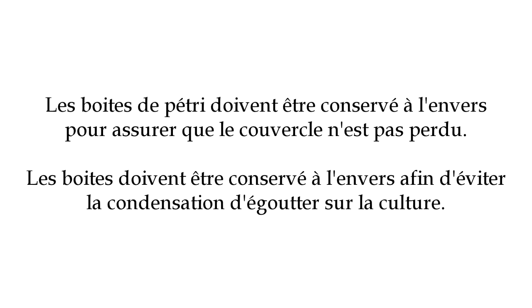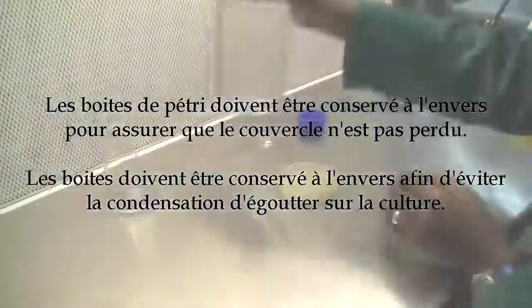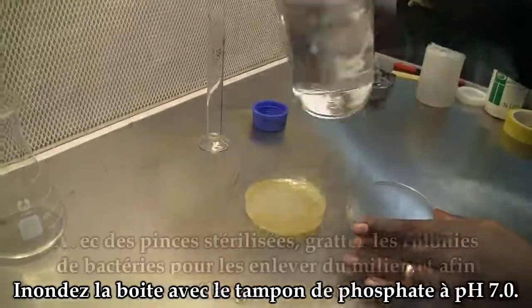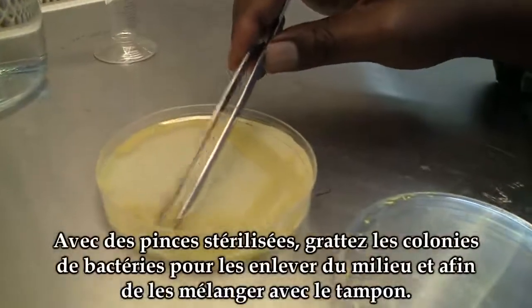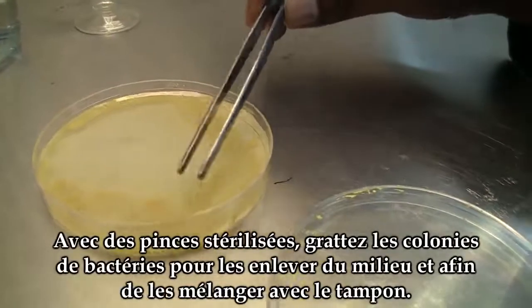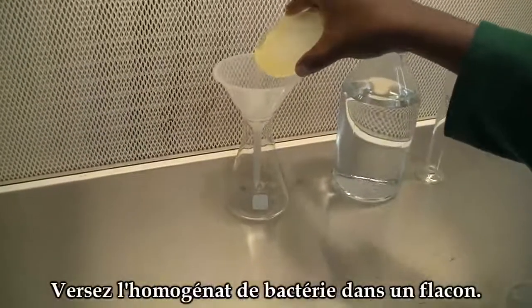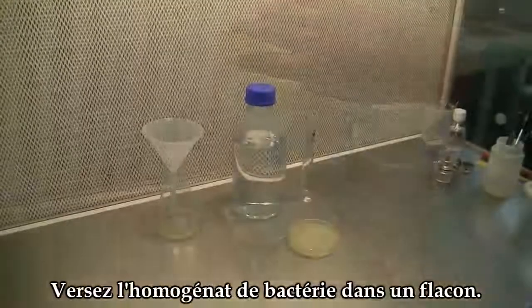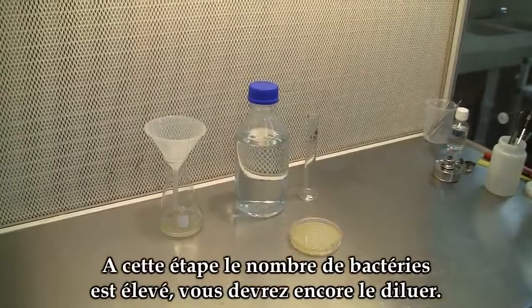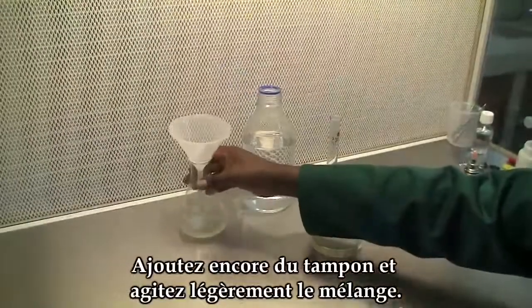The next step is to produce inoculum that you will use to inoculate plants. To do this, flood the plate with phosphate buffer. Using a sterile forceps, scrape the bacteria off the media to mix with the buffer. Pour the bacteria homogenate into a flask. At this stage, the concentration is high, so you will need to dilute it further by adding a little more buffer and shaking the mixture lightly.